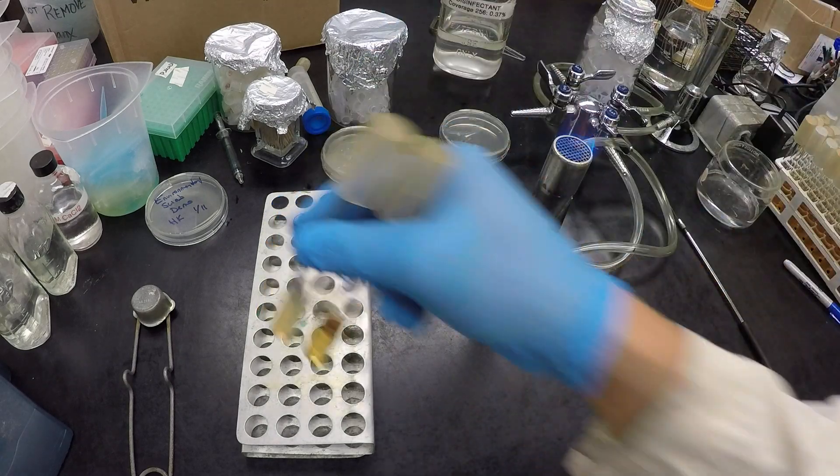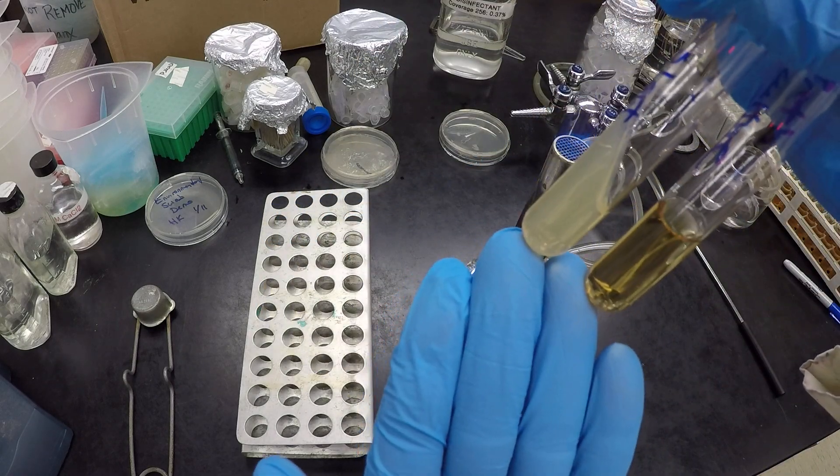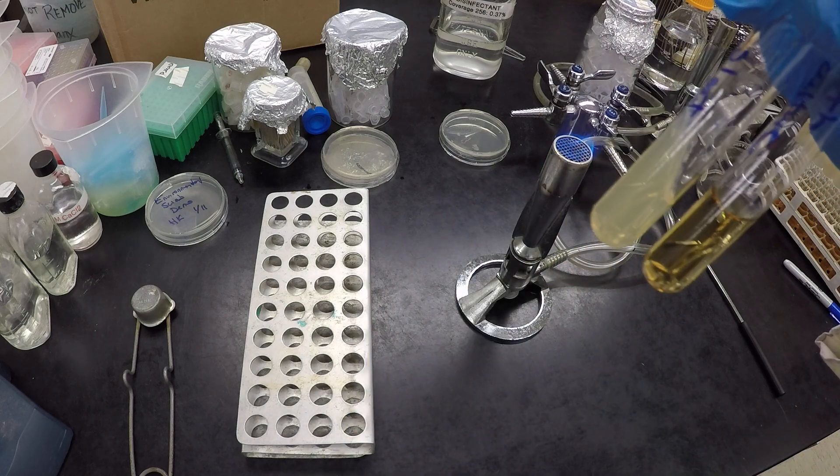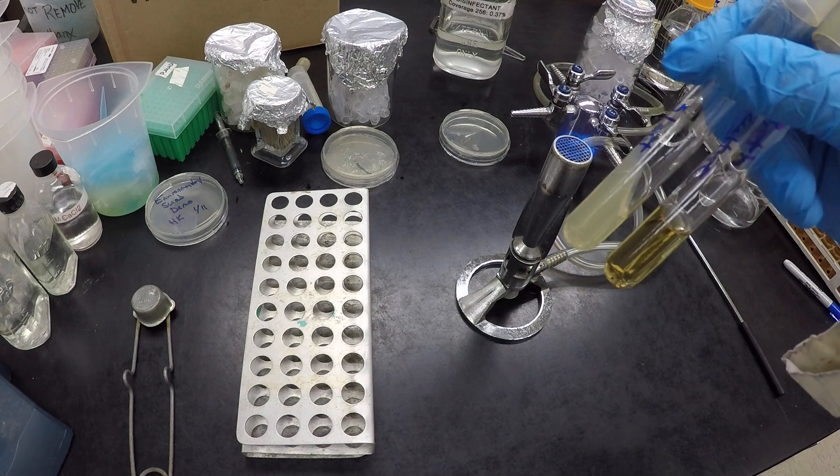We've seen these. What we're going to do is we're going to introduce a small amount of bacteria to each of these with the idea that they're going to grow up into a culture, a population of live, actively growing microbes.